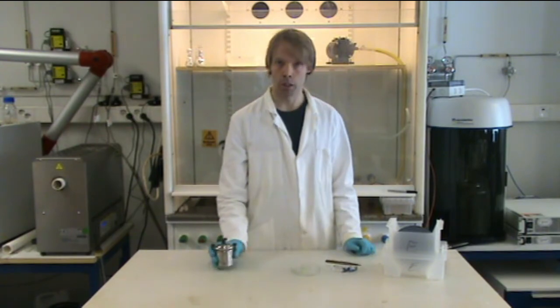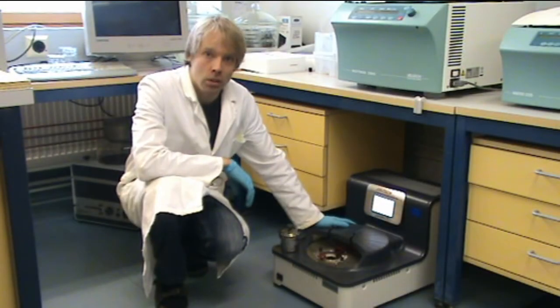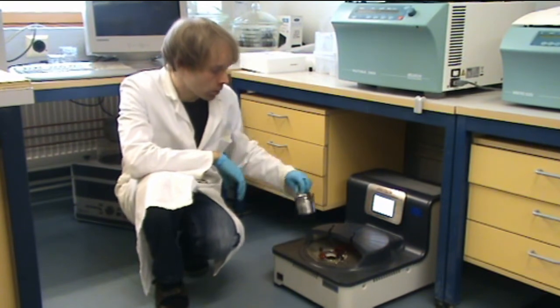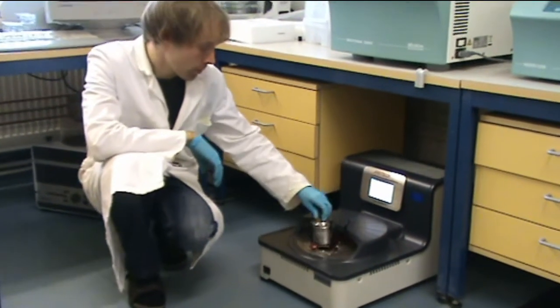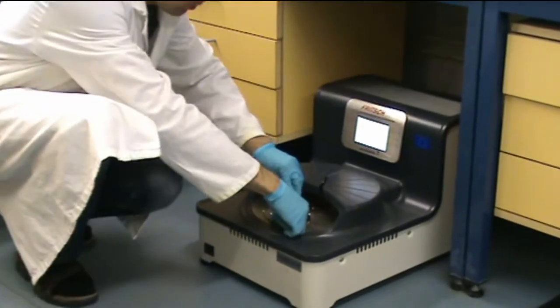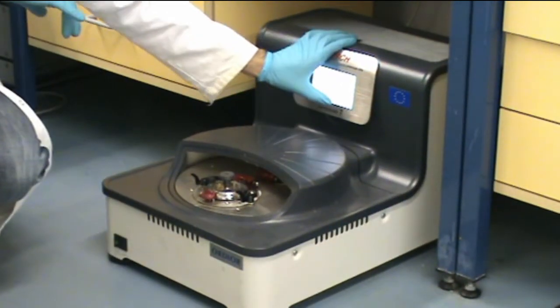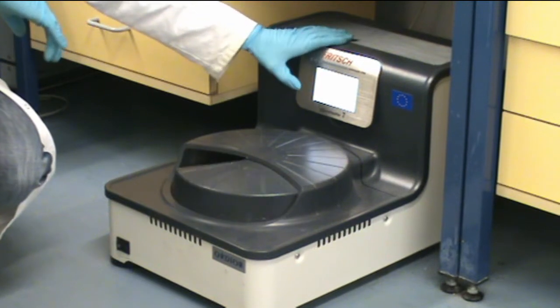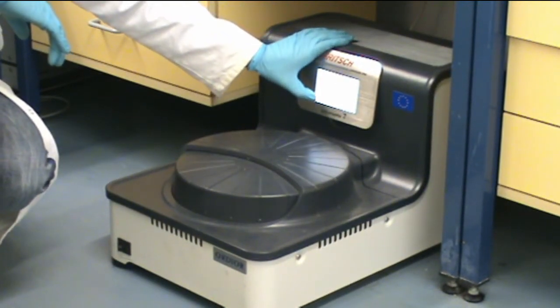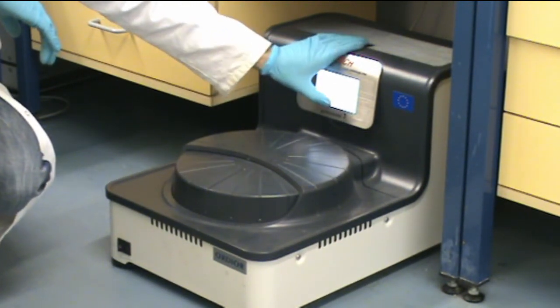And it's ready for milling. We will mill the films in a planetary ball mill. I will place the grinding jar in the mill. And we will start the mill.